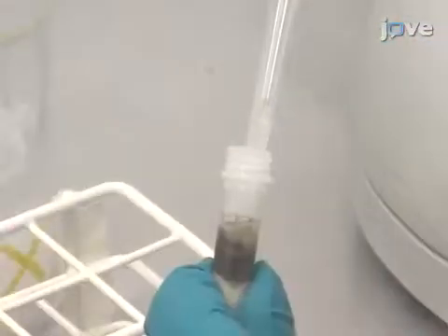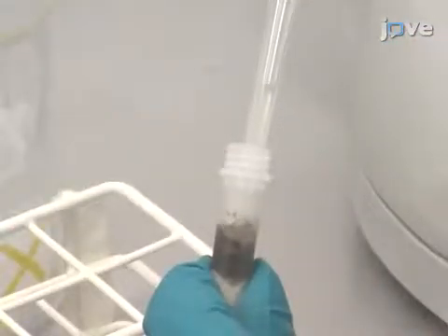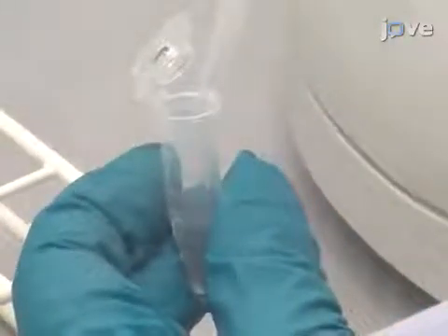Then, in a fume hood, extract the top aqueous layer and transfer it into a new sterile 1.5 milliliter microcentrifuge tube.